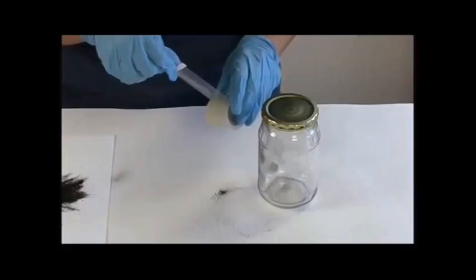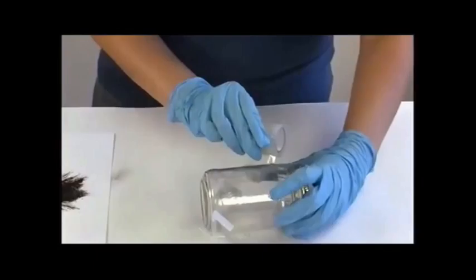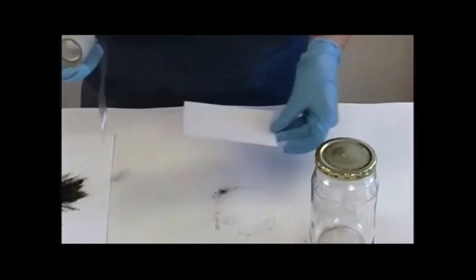Once the fingerprint is visible, get the tape and lift it by covering the fingerprint without leaving any air bubbles in the tape. Carefully lift it and put it on an index card or somewhere you can identify it and keep it in safe storage.